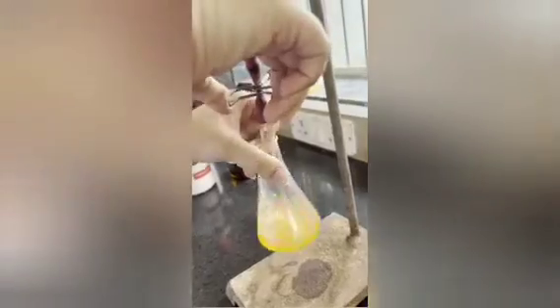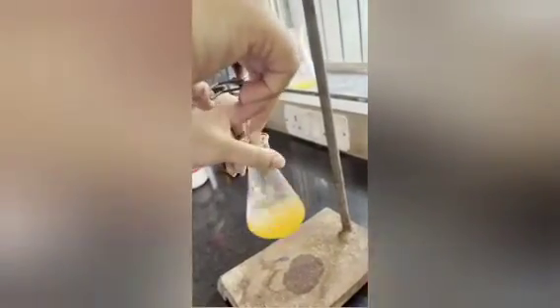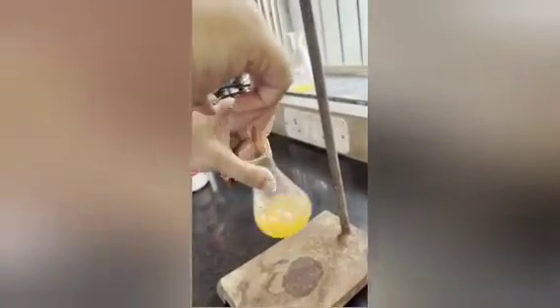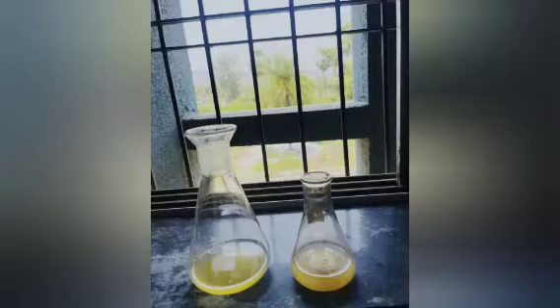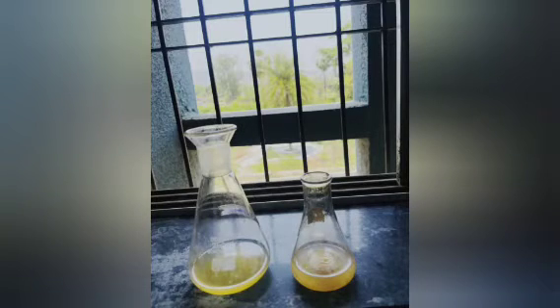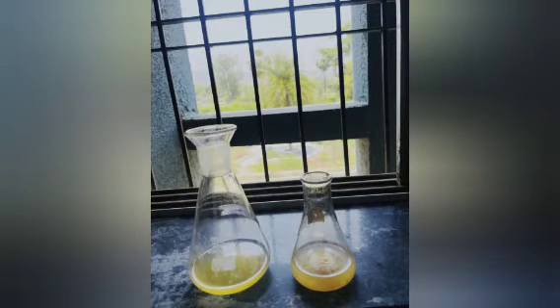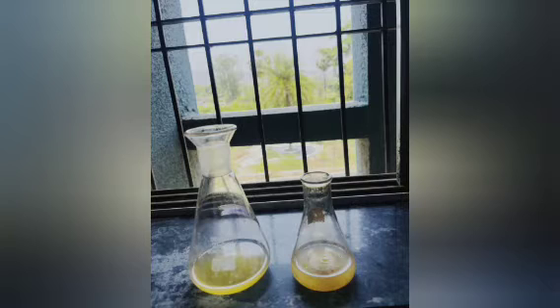Titrate it again with potassium hydroxide solution until the solution converts to yellow color. This is the result showing the citral and cinnamaldehyde content.